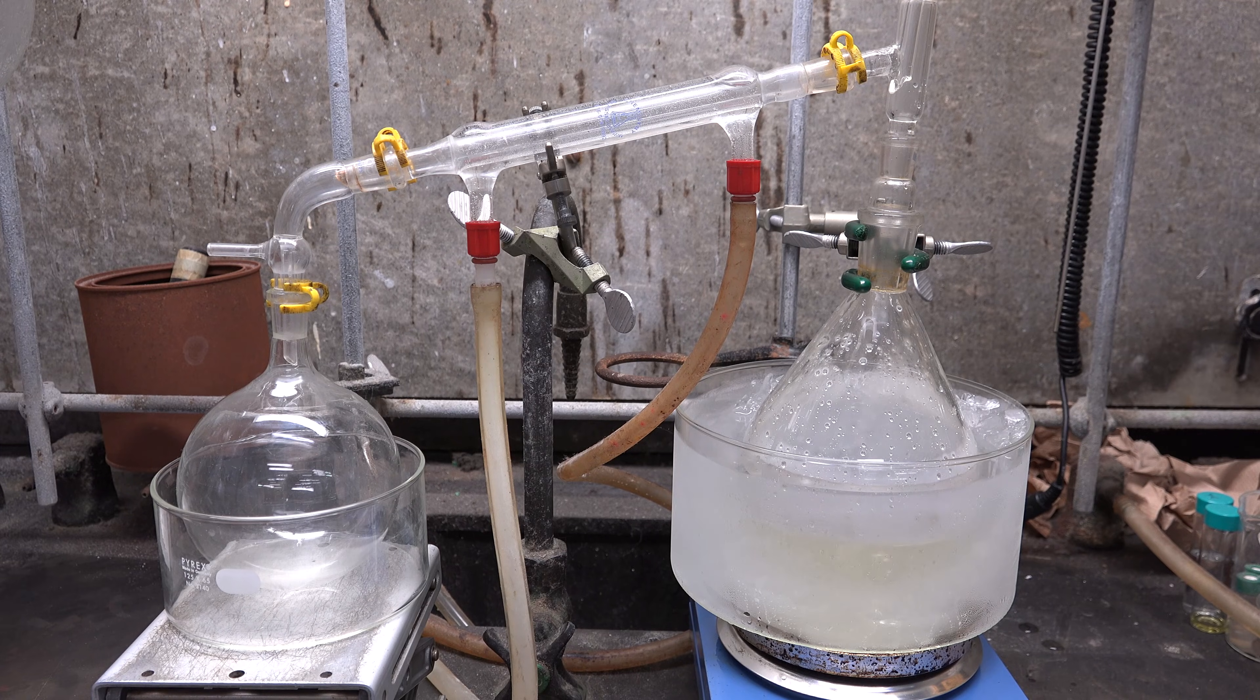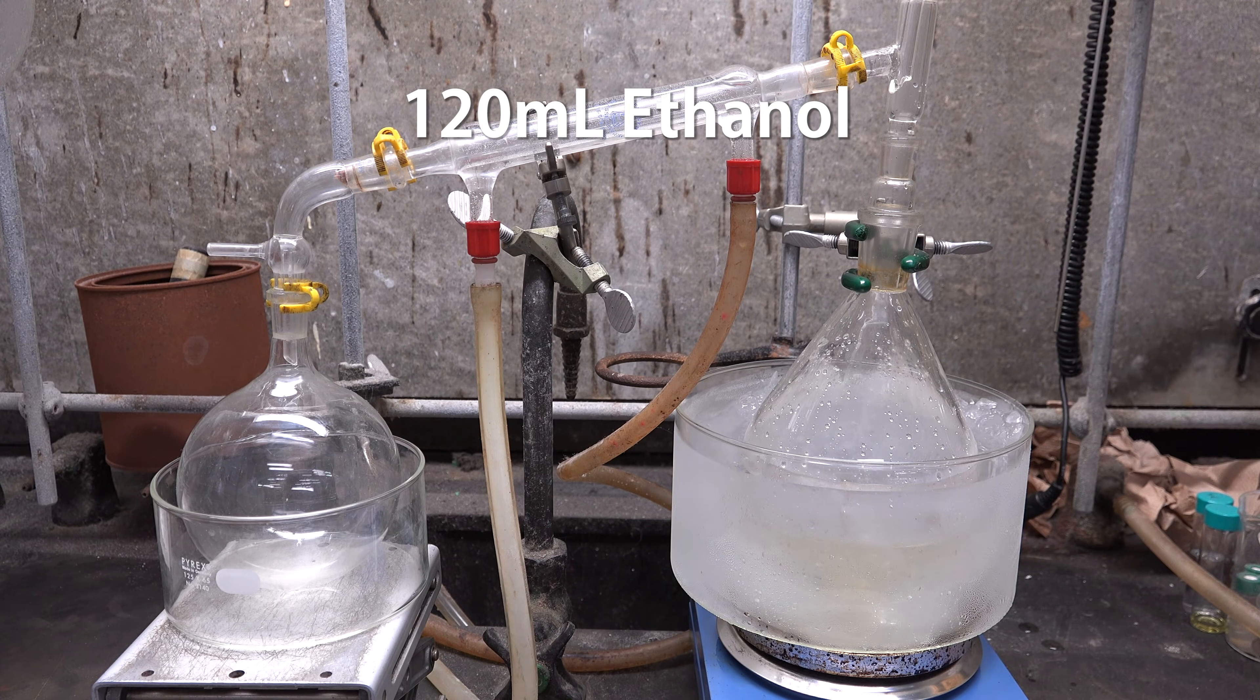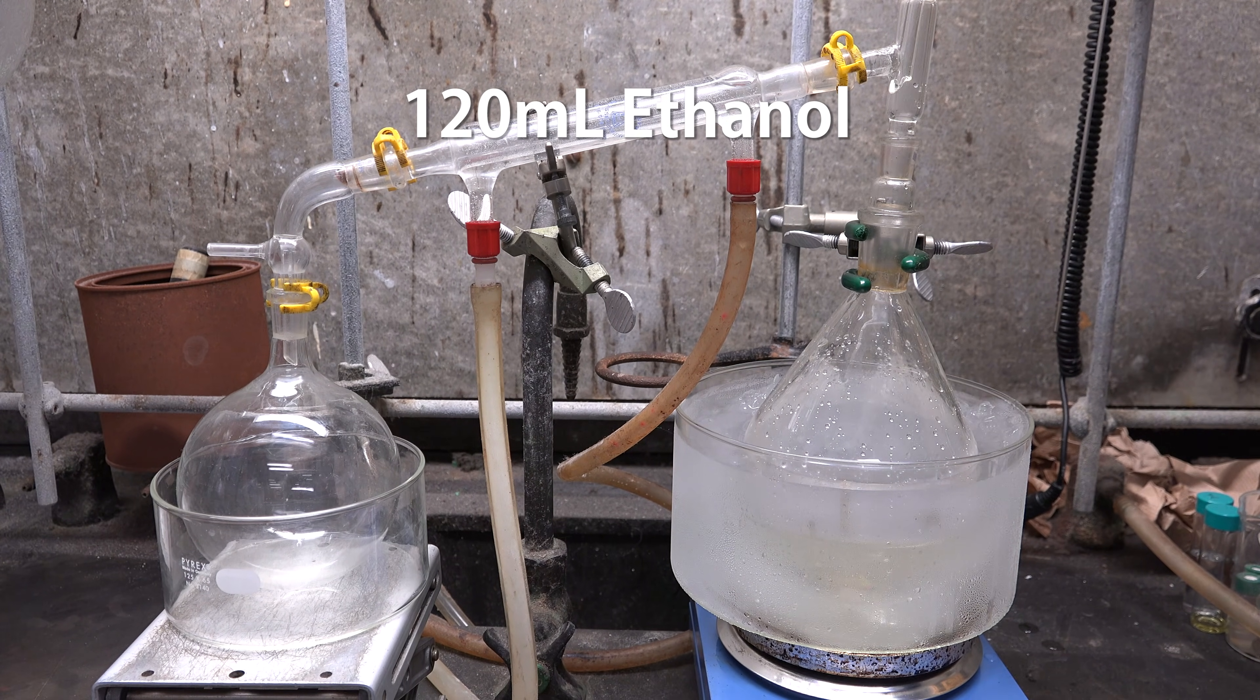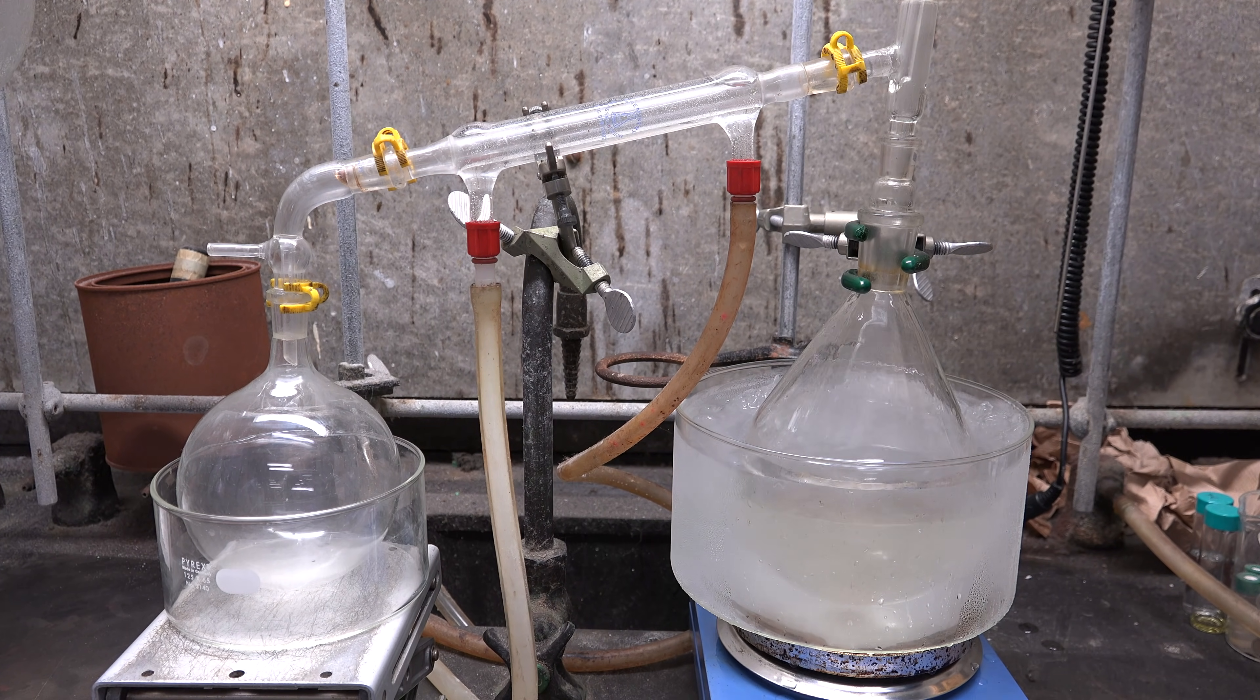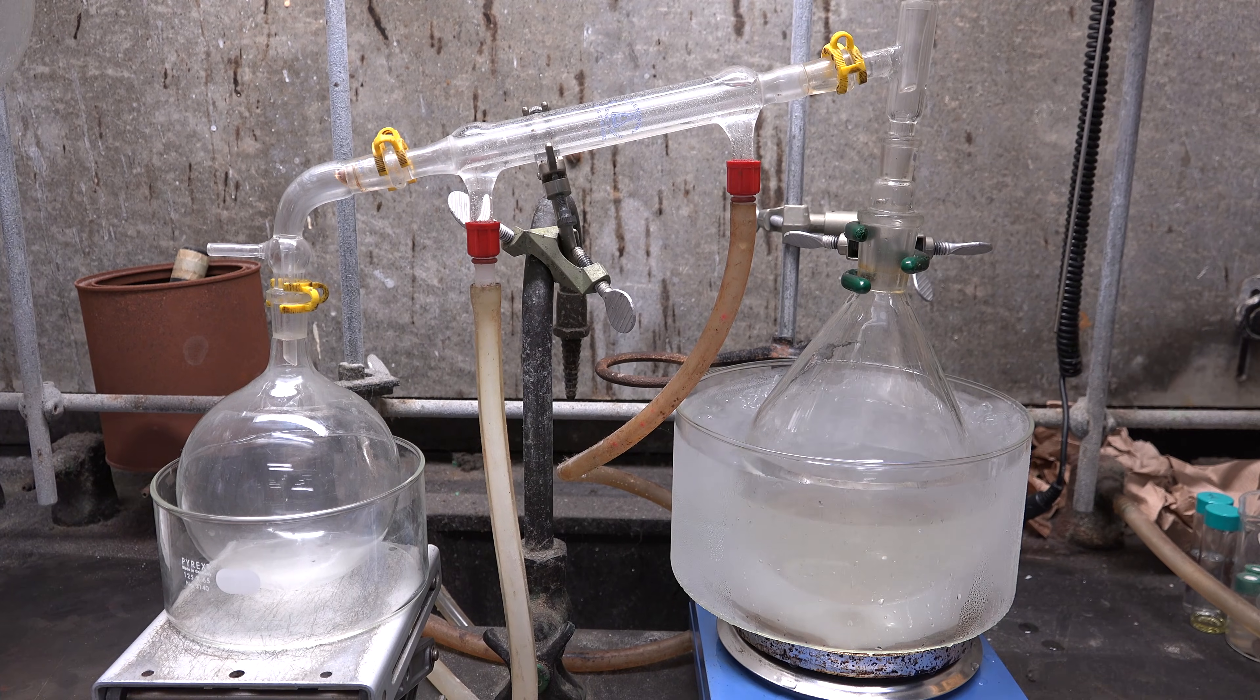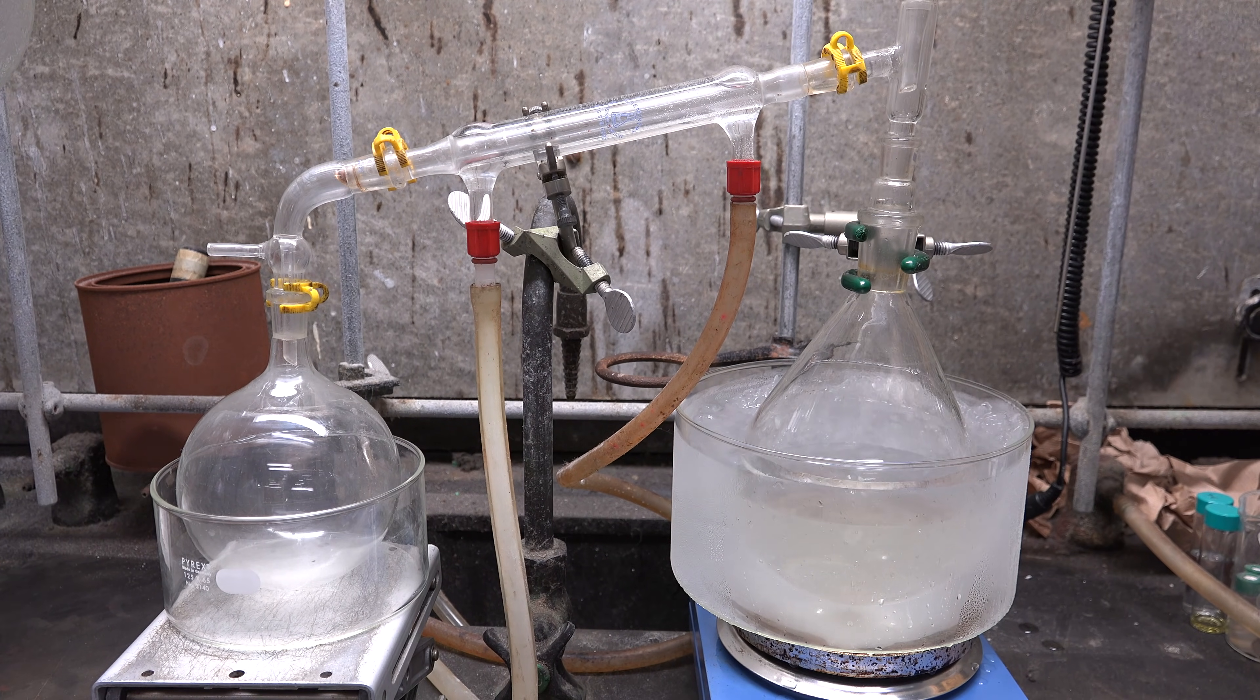Once that's all added and allowed to cool we add in 120 mL of ethanol. I'm using water-free ethanol since I had a lot but you can use easier to get 95% ethanol. Once everything is added give the mixture 20 minutes to cool.